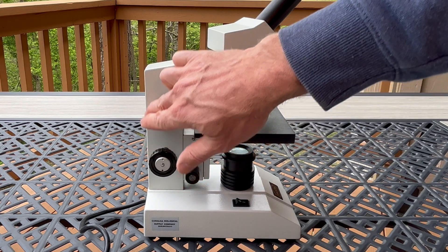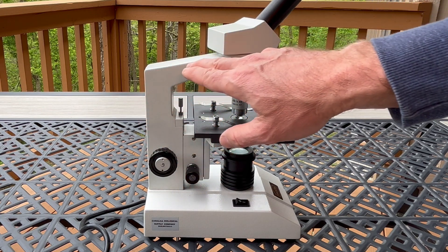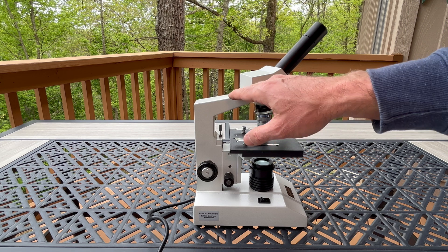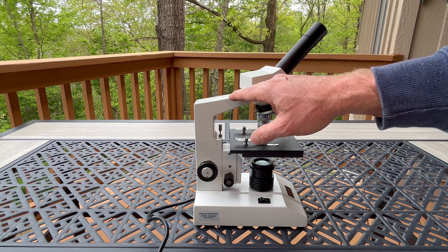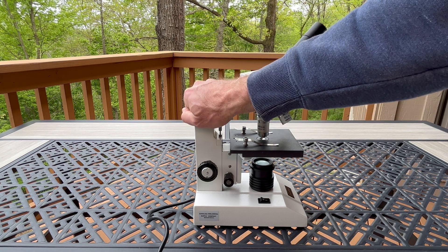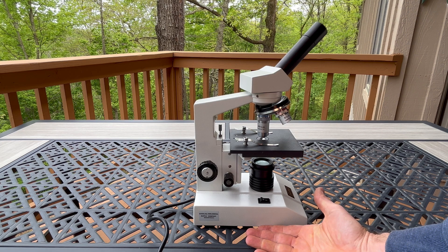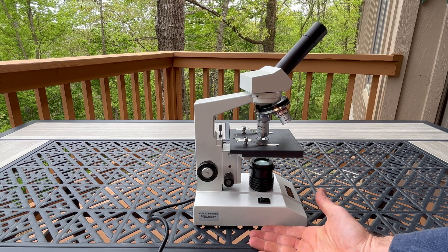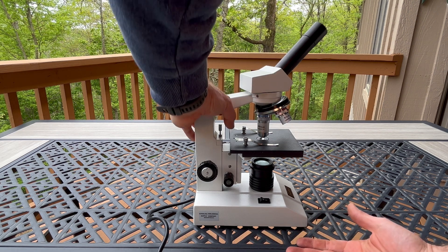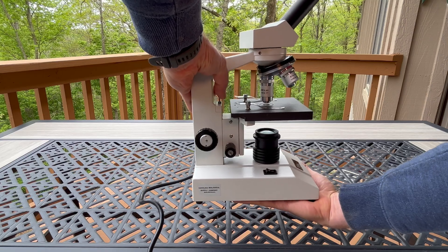This part is called the arm. If you are ever asked to carry a microscope, you put one hand around the arm and your other hand under the base — just like so.